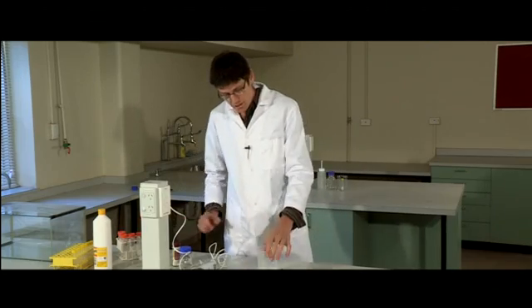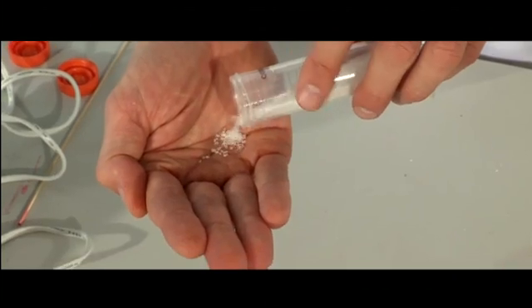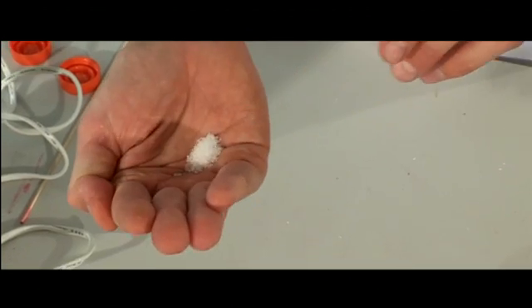Today we've got strawberries. First thing you need is a little bit of warm water and you need to get some salt. Salt is your buffer. I've probably got about two-thirds of a teaspoon there. Dissolve that in your water.